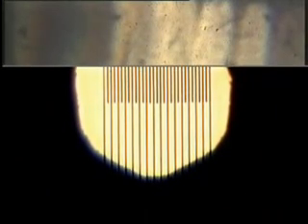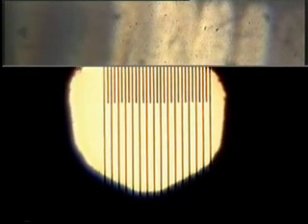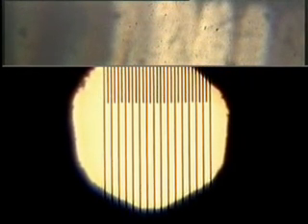Up at the top we have a fine grating. The lines are on the slide about 8 micrometers apart, and at the bottom what I'm going to call the coarse grating, with lines about 16 micrometers apart. Before we carry on, I need to focus my condenser on the illuminated field diaphragm like that, and since we'll be using it in the lower half of the screen, I'll lower it down a little like that. So there we have that ready to go.